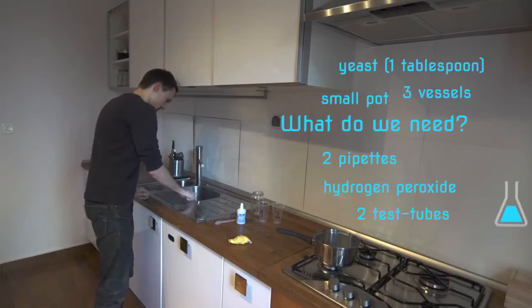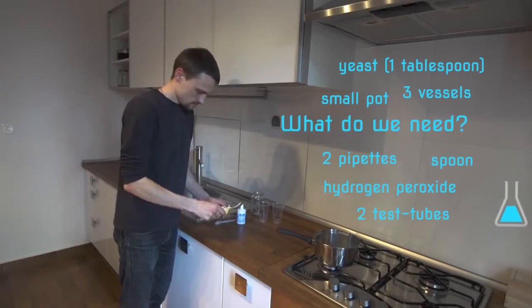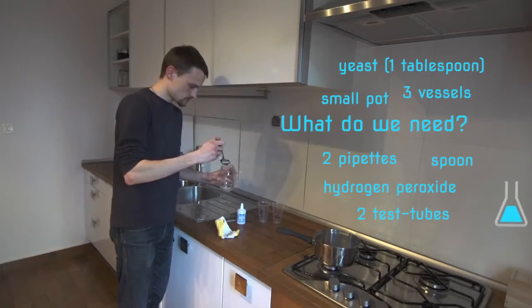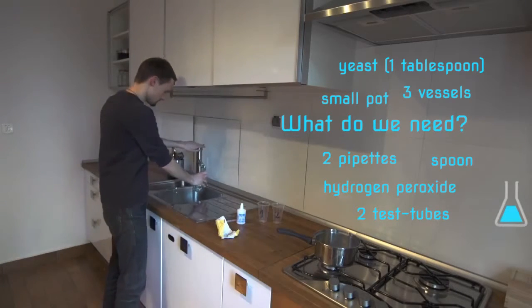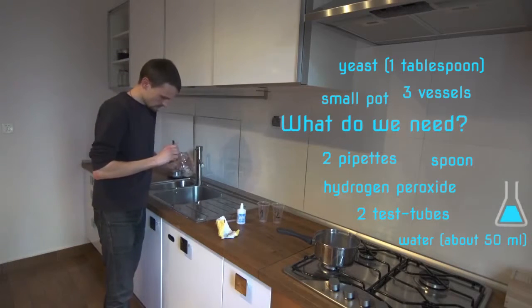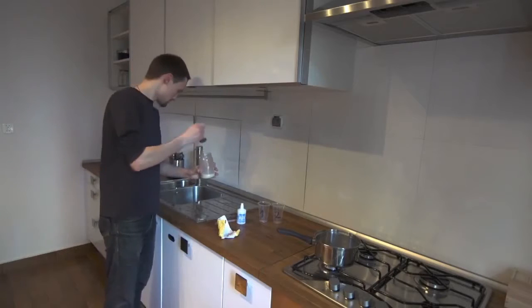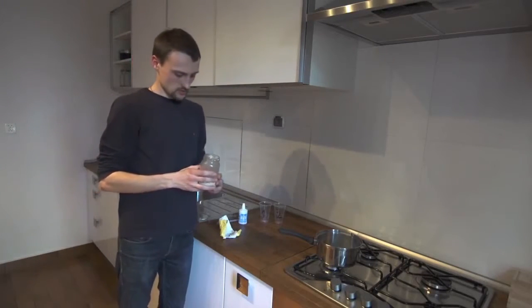We also need a spoon which we use to collect a little yeast, which we then dissolve in a little water until we obtain a homogeneous mixture. Now that we have obtained a homogeneous mixture of yeast, we have to divide it into two halves.